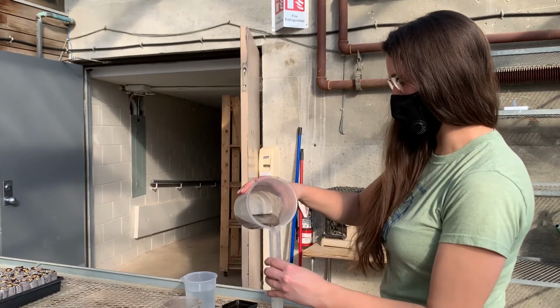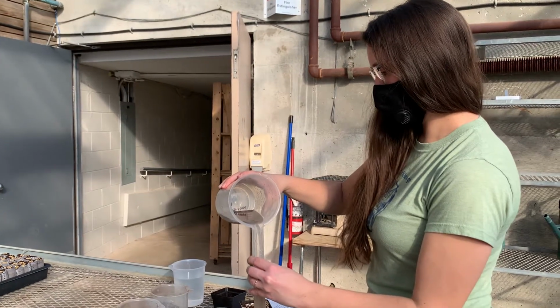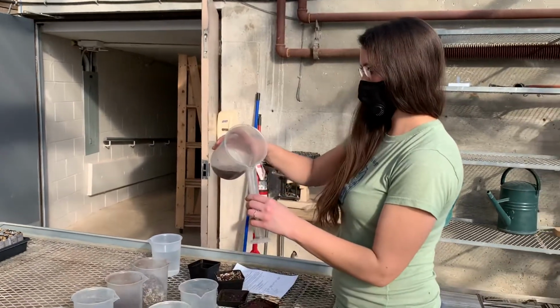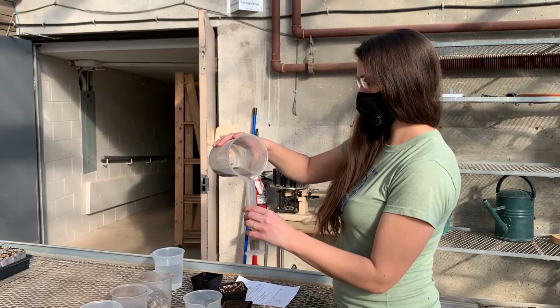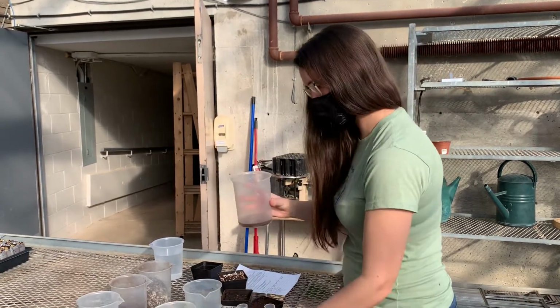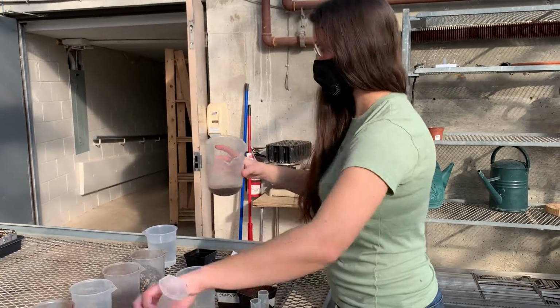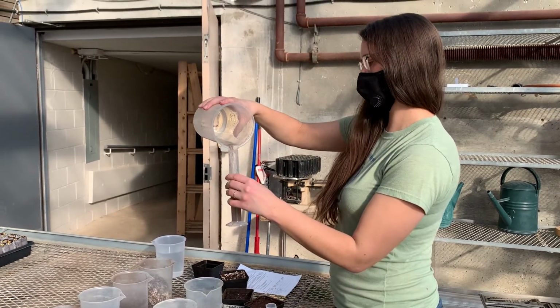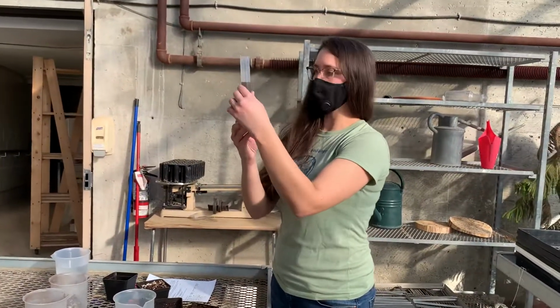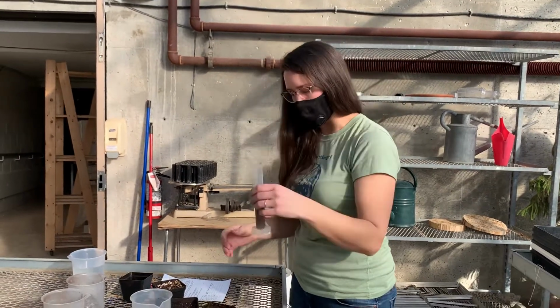And this one likely will need a couple graduated cylinders as well. Okay, gravitational water for the forestry mix is 145 milliliters. So you can take those numbers, fill in your part of your chart, then plug them into the calculations to fill out the rest of your chart and answer the questions.